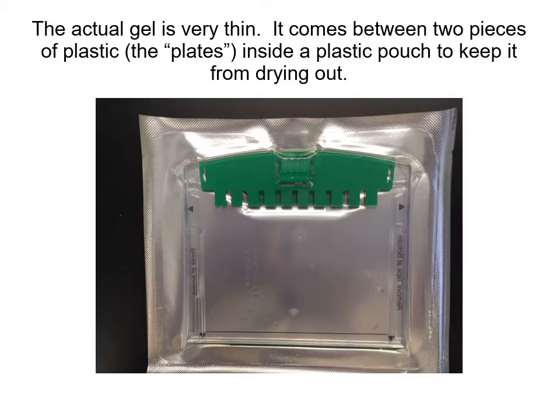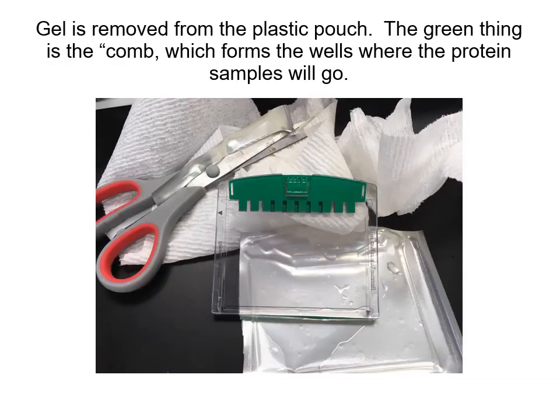Okay, so here's a picture of a gel. It's as we purchase it. It comes in a plastic bag with inside a plastic pouch to keep it from drying out. Okay, so you take the gel out of the plastic pouch. The green thing is the comb, and when you take it out, it forms indentations in the gel, and that's where the protein samples can go.